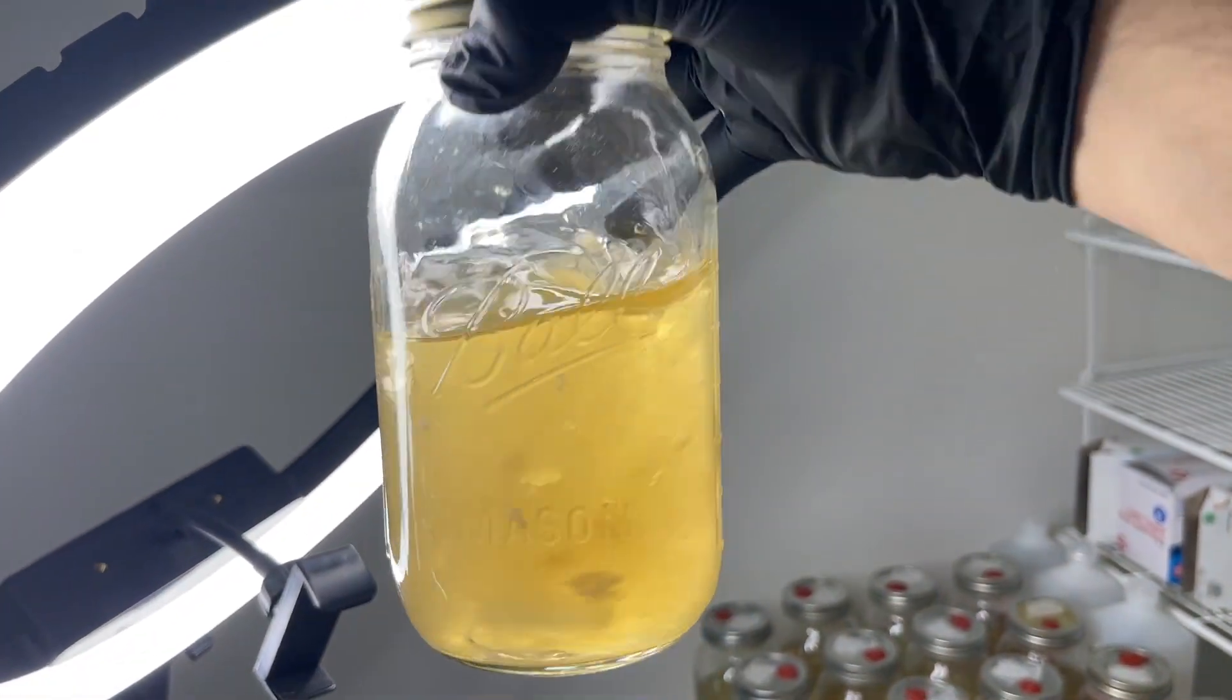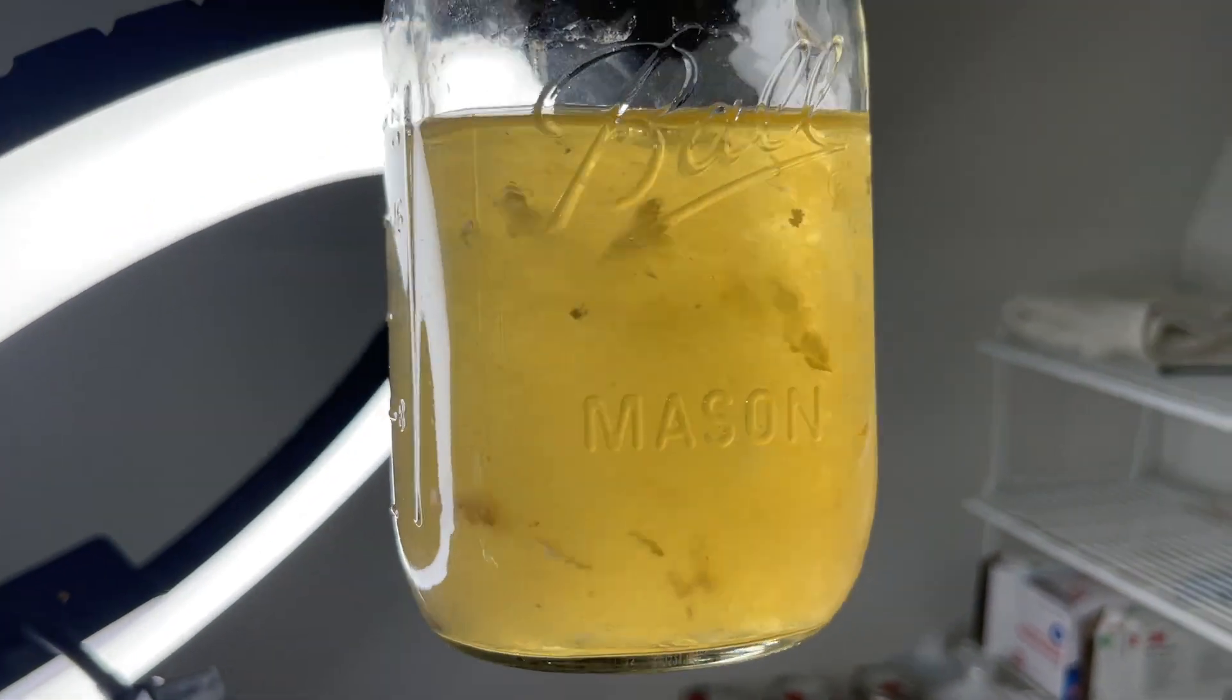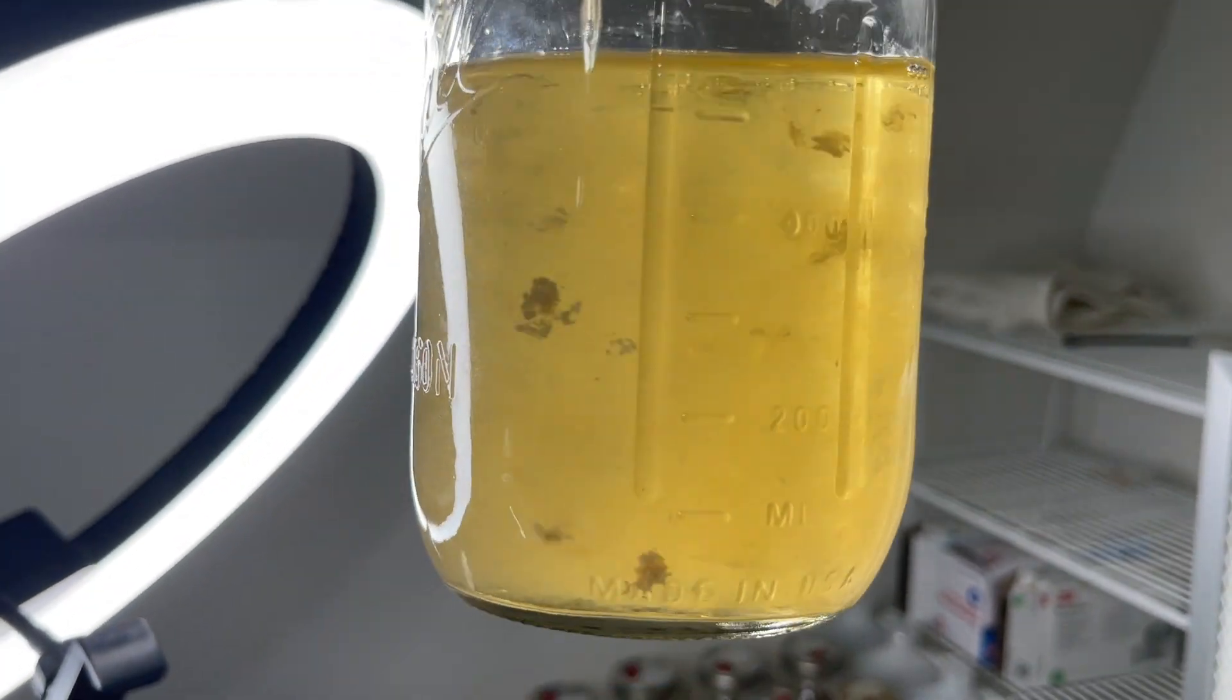This liquid culture is black reishi, which always grows really thick pieces of mycelium and also needs to be stirred often.